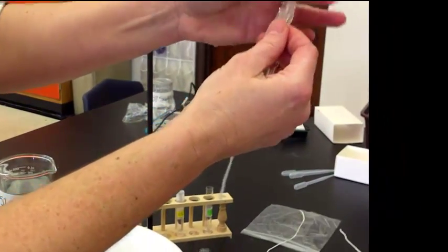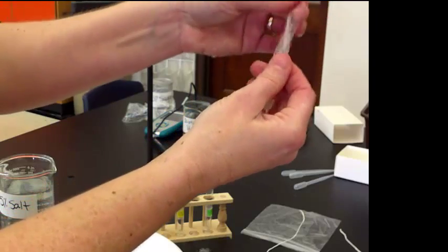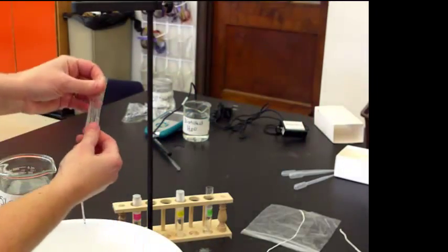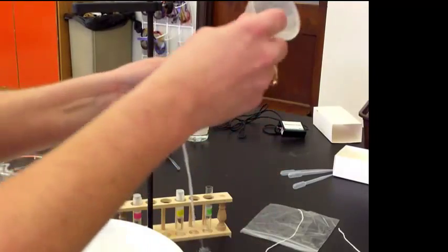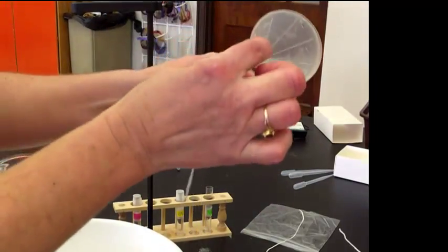So I've got the end tied. Now, we're going to open up the top, and you just have to roll it between your fingers. Again, if it gets sticky, just run it in the distilled water, not tap water. Now we have a funnel to help fill, and this is a very messy lab.